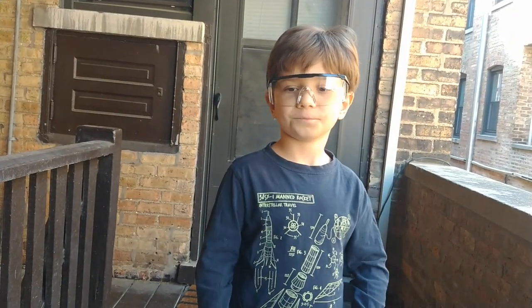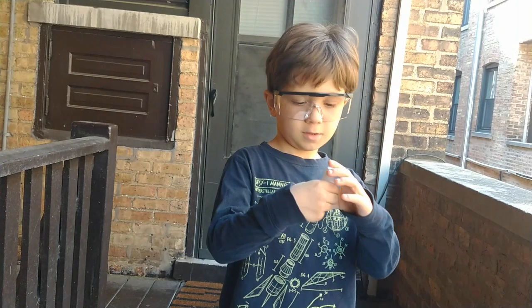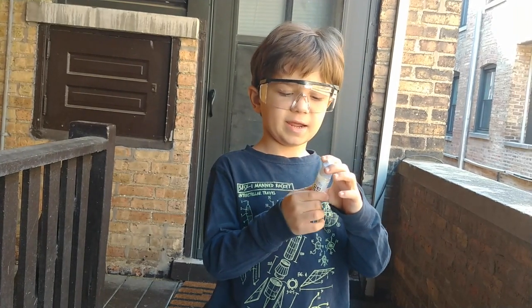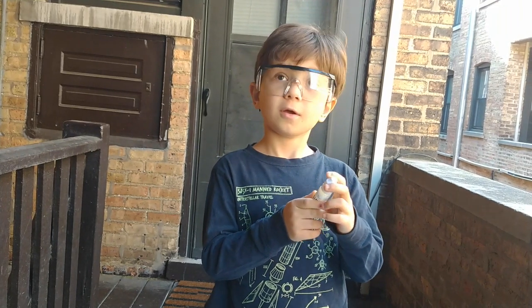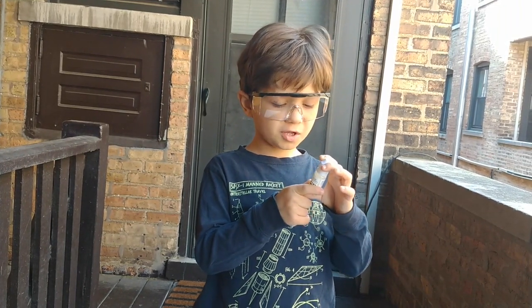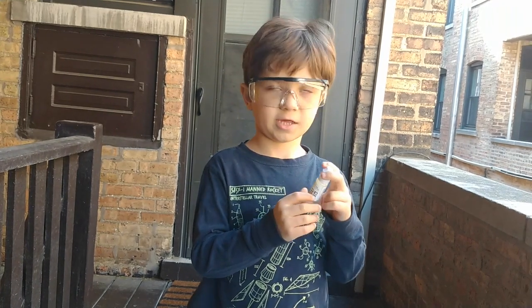Good. So what demonstration are we doing today? Sugar snake. That sounds interesting. What are we going to put in to do the sugar snake demonstration? NaHCO3. And what's NaHCO3? Sodium hydrogen carbonate. Which is also known as? Baking soda. So it's also known as baking soda.